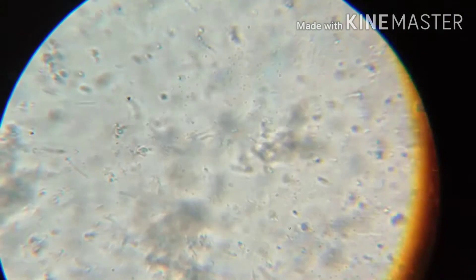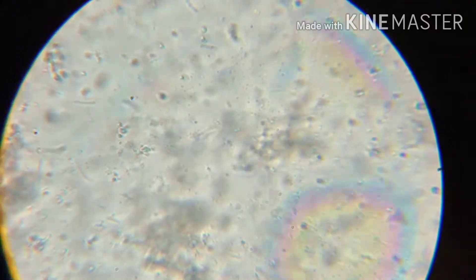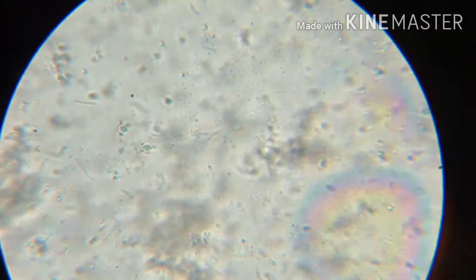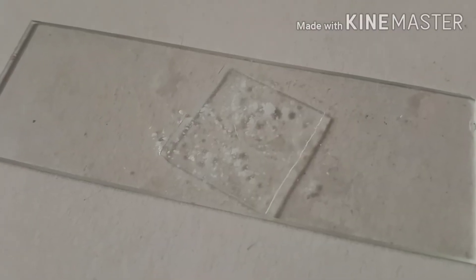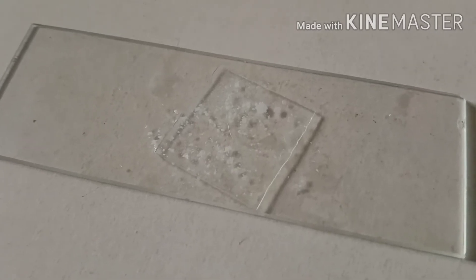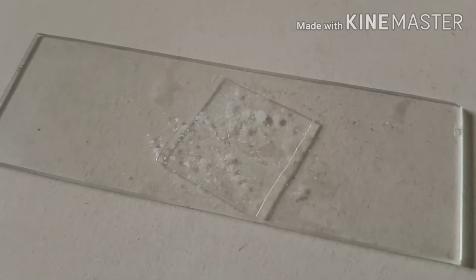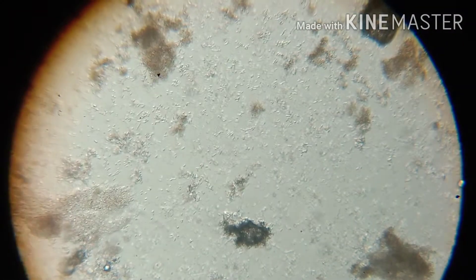Now here is the sour curd specimen which I took. Hopefully you'll be able to view it in this video. This is the sour specimen — you can see there are some bacteria present here.